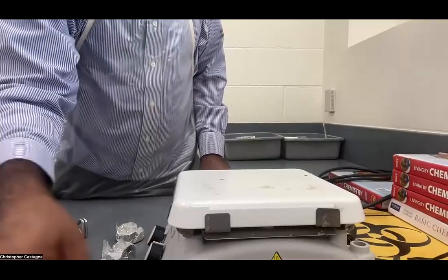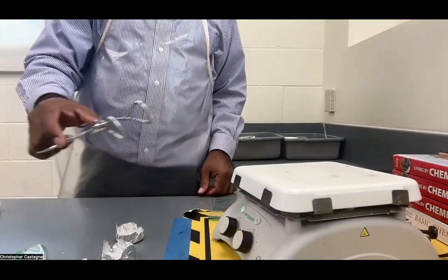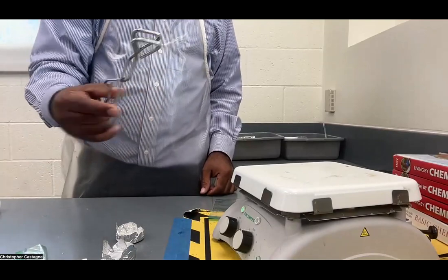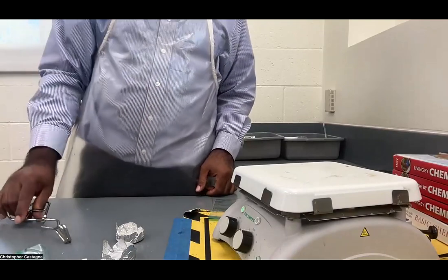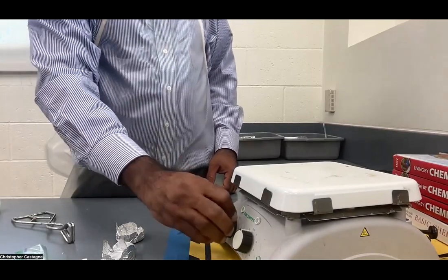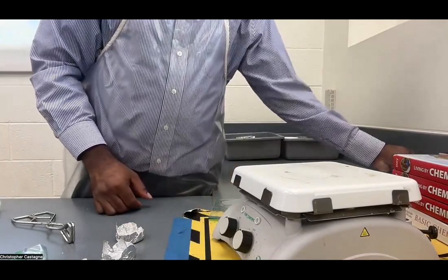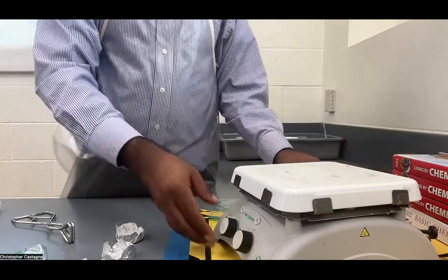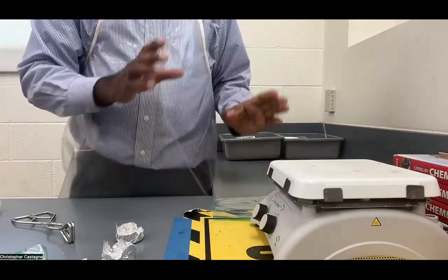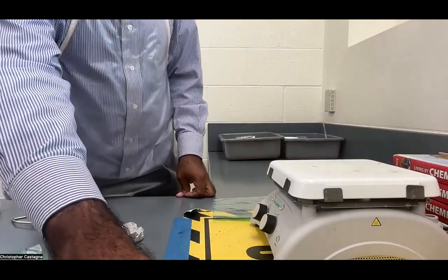Make sure to take all the foil off with the tongs, not with your hands. Then turn off the heater, unplug it, push it out of the way, and stay away from it while it cools down.